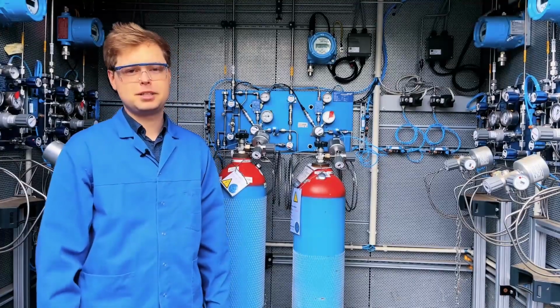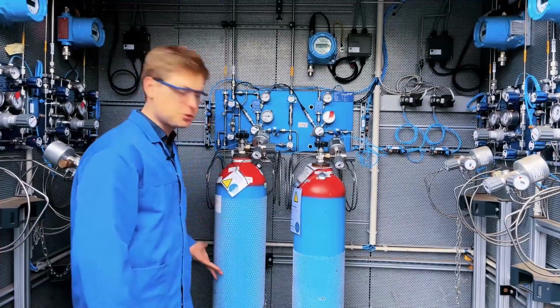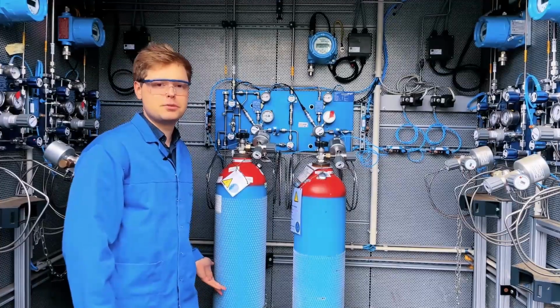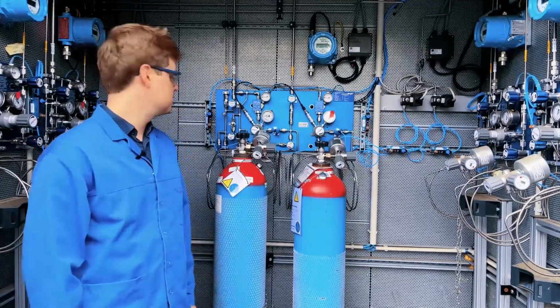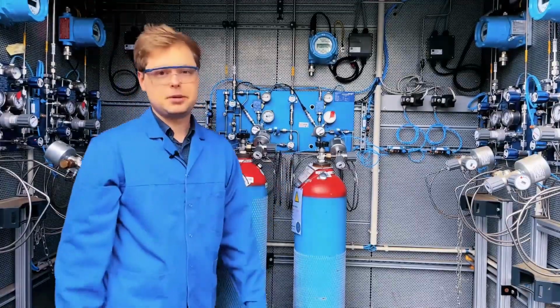Exactly. In the hot wall reactor, we produce mainly silicon-based materials from monosilane. This is a gaseous compound consisting mainly of silicon and hydrogen. So the process starts here at the gas bottle. And let's see the rest.